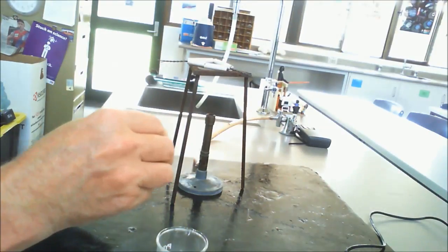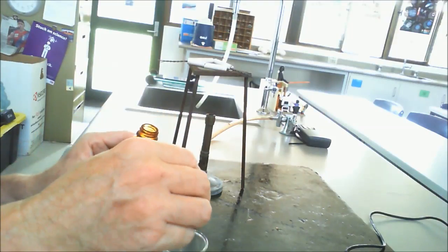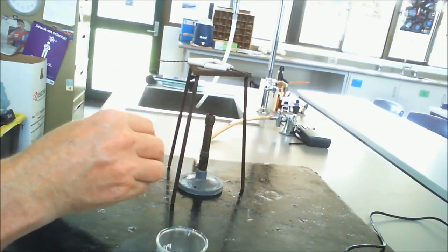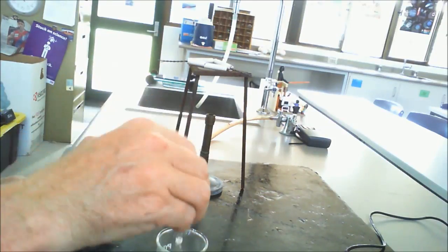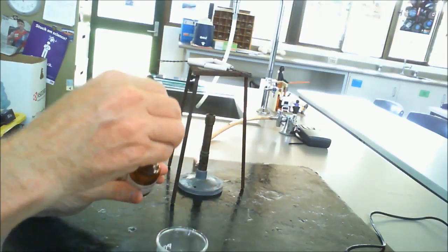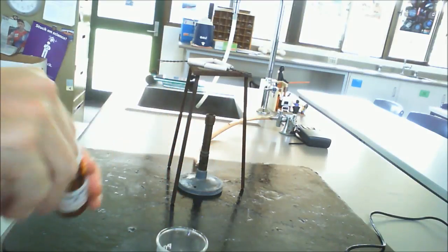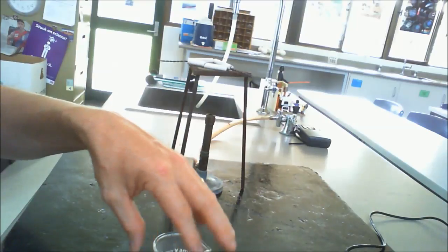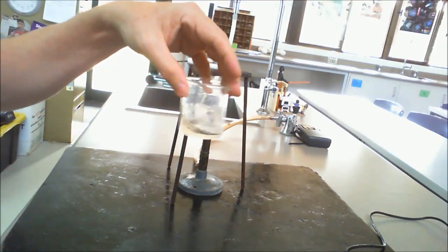Obviously with a chemical reaction we are rearranging what we put in, so the calcium carbonate and also the acid. So just keep putting in, just to make sure that we have nothing else that is still bubbling there. So once it has finished bubbling, that then tells us that the acid is basically used up. So you can see what we end up with there.